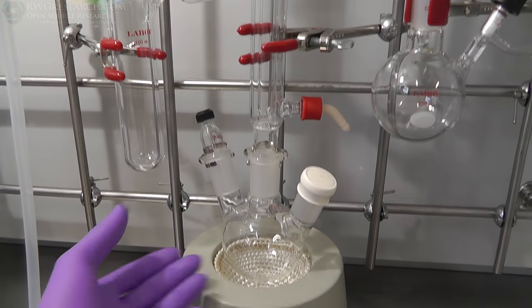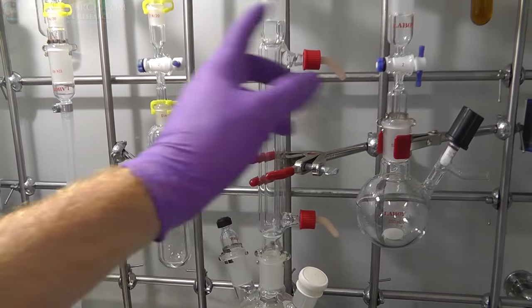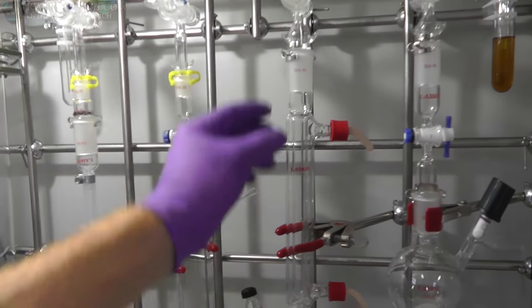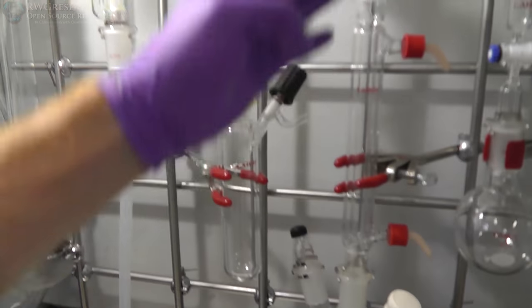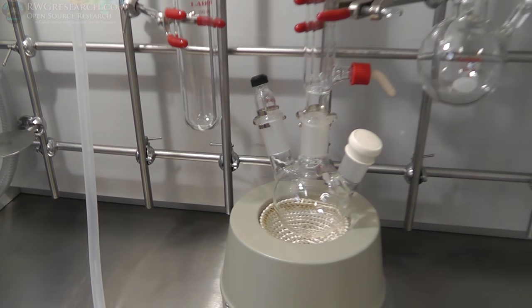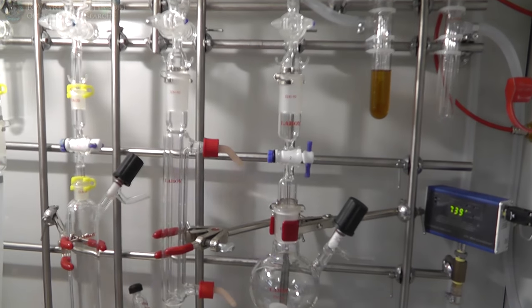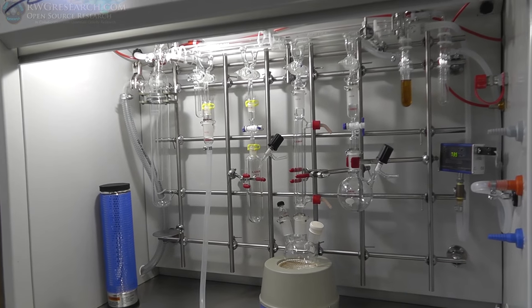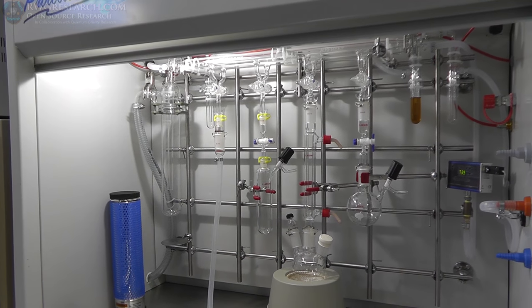So let's say you were heating up this flask with this heating element that needs to be jacked up a little bit, and you want to run cooling water through here, which would be actually connected to this chiller here, and then you could actually condense things as you were heating it. Let's say you wanted to add some argon or transfer something without opening this top valve. You could do that. Let's say you wanted a thermocouple in here or a thermometer to actually see the temperature, and this one maybe you were just doing holding or something. And again, I put this in here in case I needed to transfer something. But yeah, that's a typical setup maybe that you could use in this sort of atmosphere. So yeah, I didn't grease any of the fittings, I just assembled it so you could kind of see what it may look like finished.